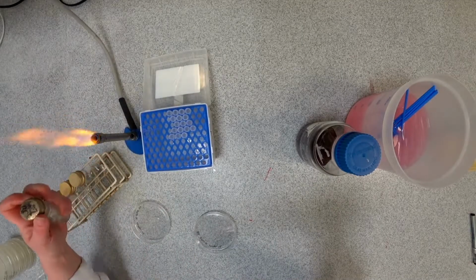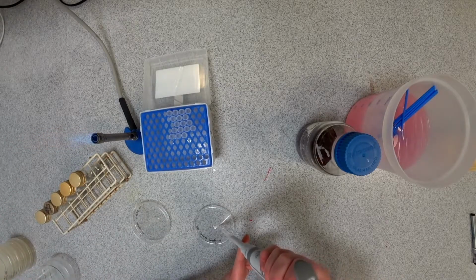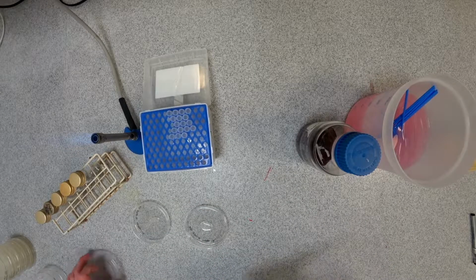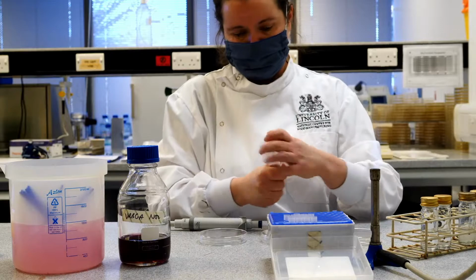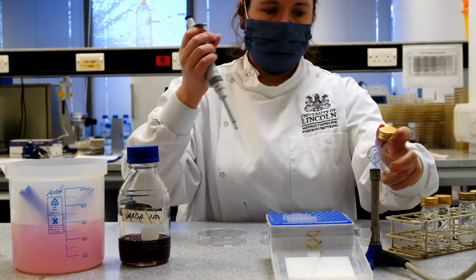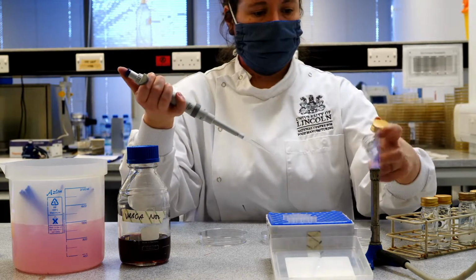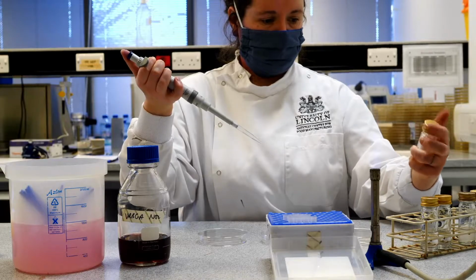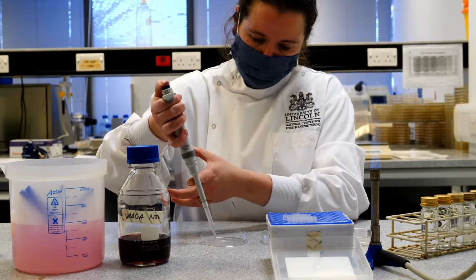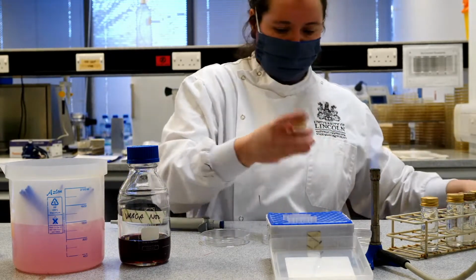So 1 milliliter of my 10 to the minus 2 dilution. 10 to the minus 3.